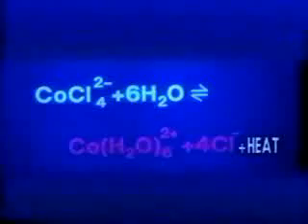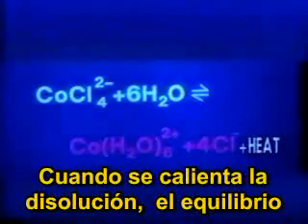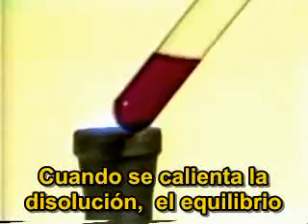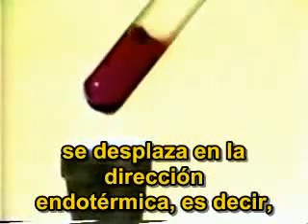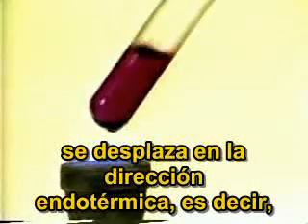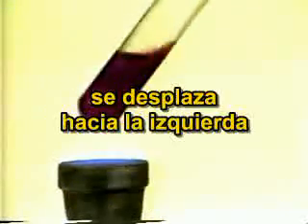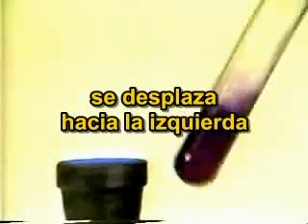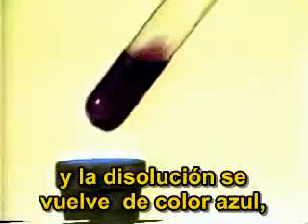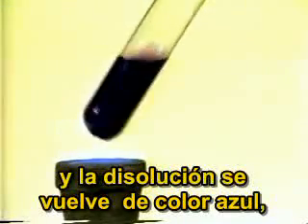We will now illustrate the effect of temperature on the equilibrium. When the solution is heated, the equilibrium shifts in the endothermic direction — that is, it shifts to the left, and the solution turns blue because more chloro-complex is formed.